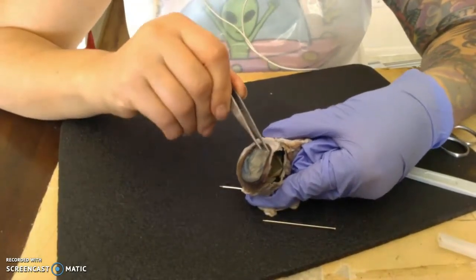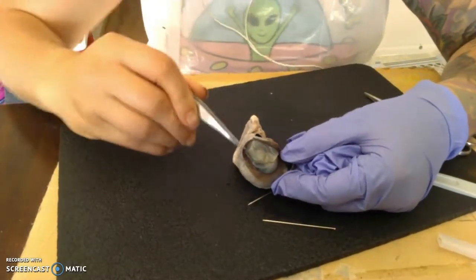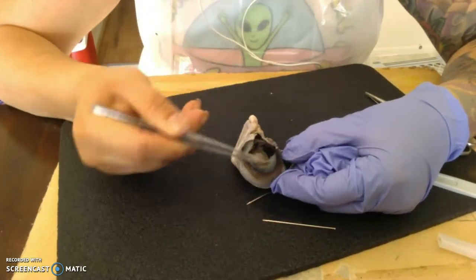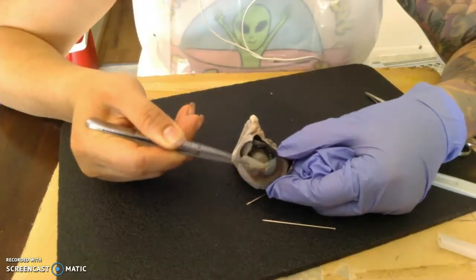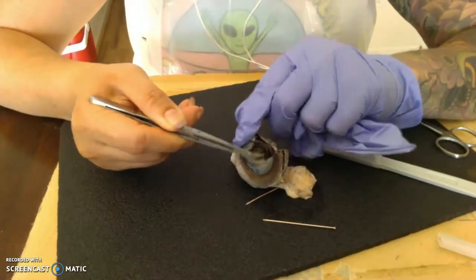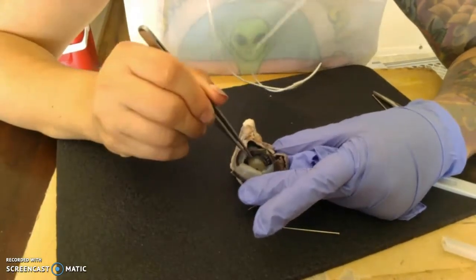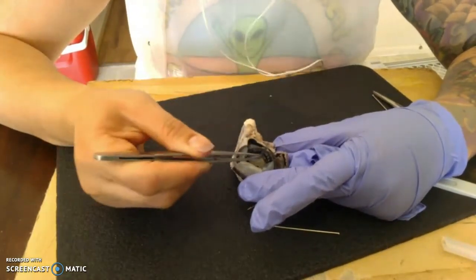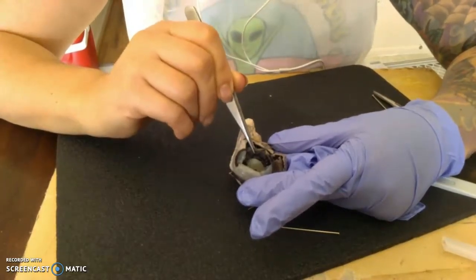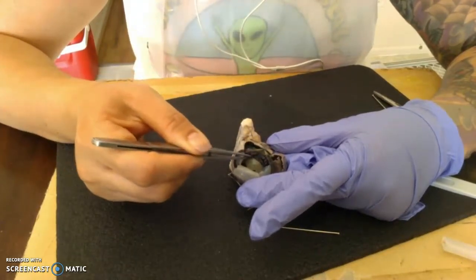This is our cornea, and that is going to be this fairly thickish translucent membrane, which is the outermost aspect of the sheep's eye. And then if we pull it back, now we can see our pupil, which isn't actually a structure but more of an opening that is formed via the iris. And then this is the iris right here, and then once again this is our pupil.